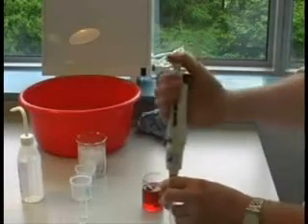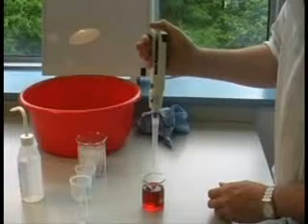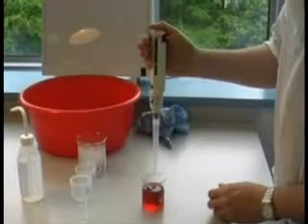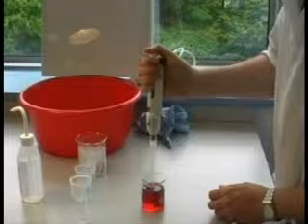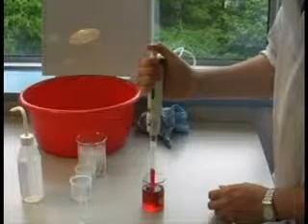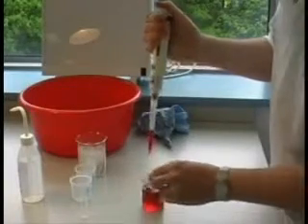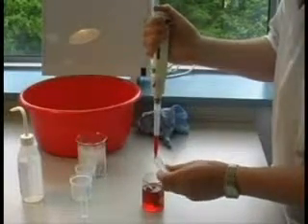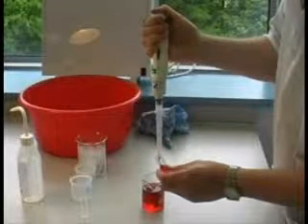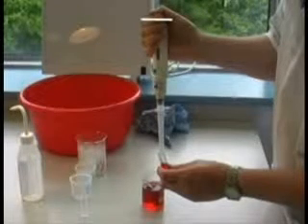Correct usage of a pipette should be performed as follows. Expel the air to the first stop, as shown in the video with a line. Carefully immerse the tip in your sample and slowly draw up the liquid in a controlled manner. Take your pipette to a suitable receptacle, such as a cuvette, for dispensing, and expel your sample slowly to the first stop, then continue to the second stop to fully dispense the sample, again shown in the video with a line.